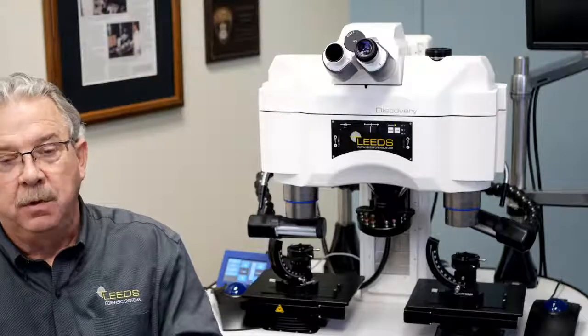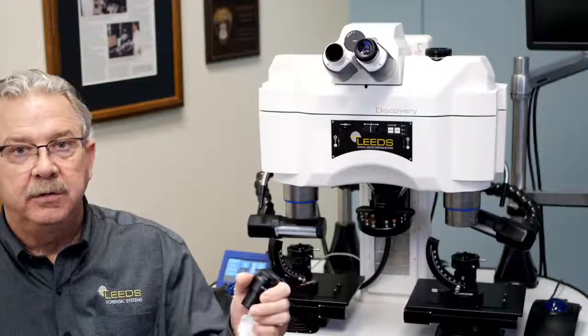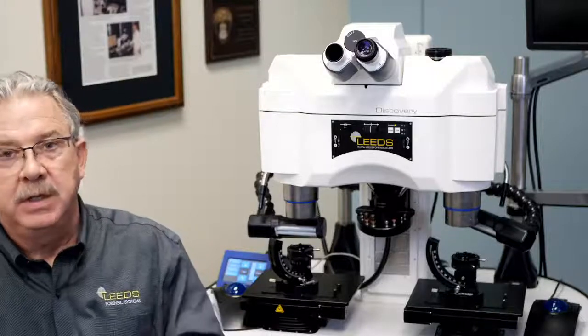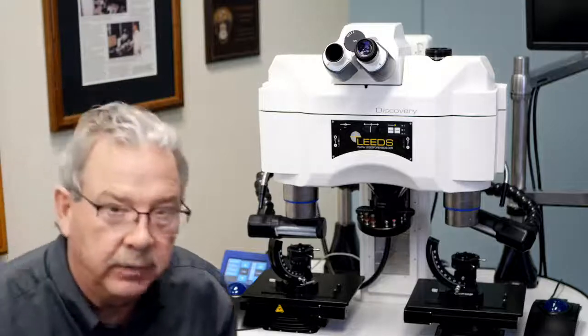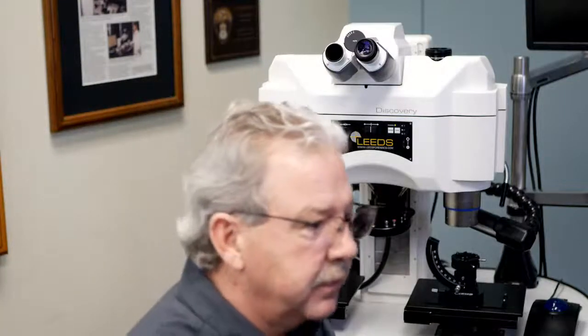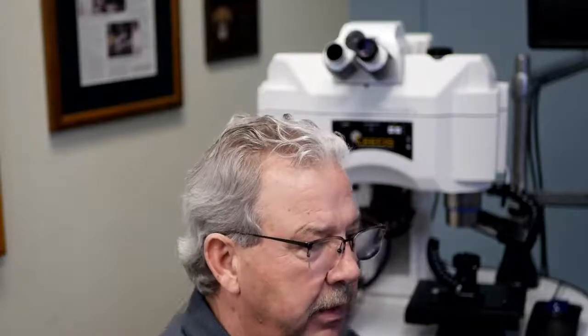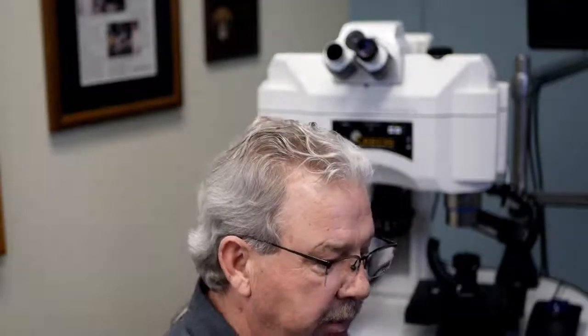Okay? So the neat thing about it is the wider my field of view is, the greater the area that I'm going to see at any given magnification. So we're going to hop over here a minute. We're going to take a look at just a few pictures of some eyepieces that I've gathered. So hopefully what you're seeing right now is actually the eyepiece itself. There's a picture of an old AO eyepiece there.